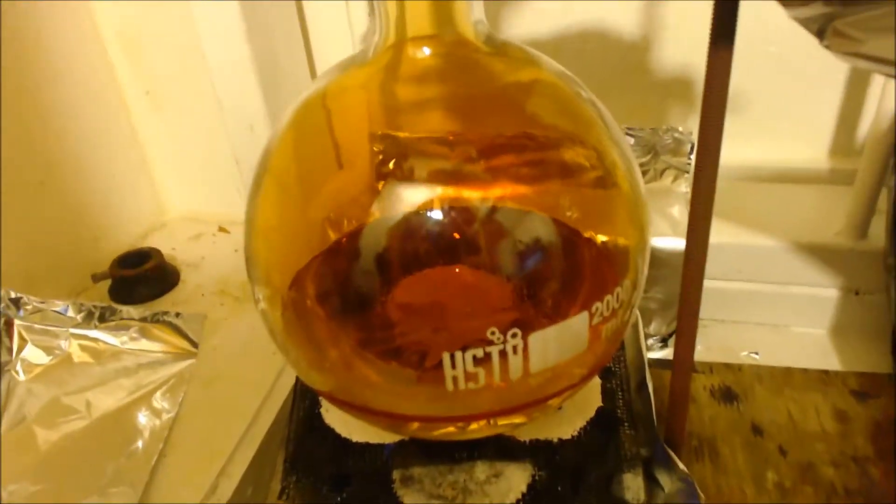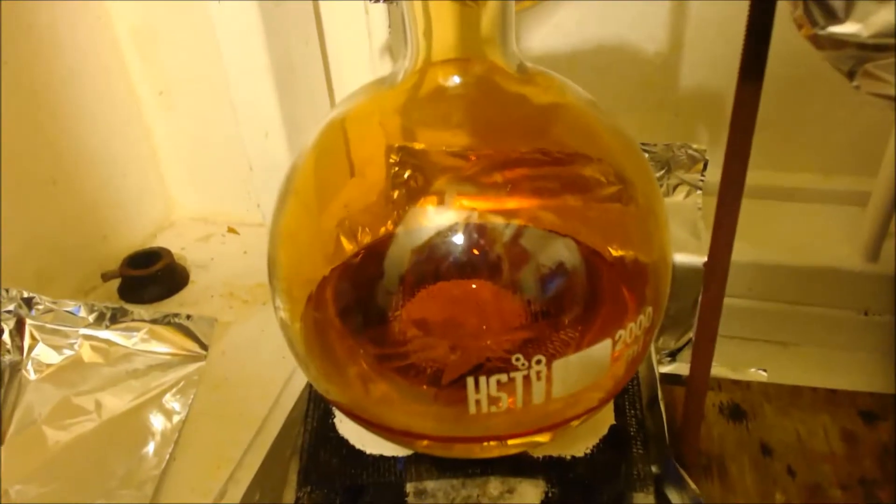You can see it's not like when you make nitric acid. All that nitrogen oxide gases, they're staying in there. Hopefully they won't come out. One thing I hate about this condenser right here is that it gets clogged up because the little tube inside the coil, that's where your fumes go from the pot. When they condense, sometimes they get stuck in there and it builds up pressure. But what I like about this is that same exact thing, because it builds up little puddles in there and blocks the thing, it blocks gases from coming out like nasty gases like nitrogen oxides.